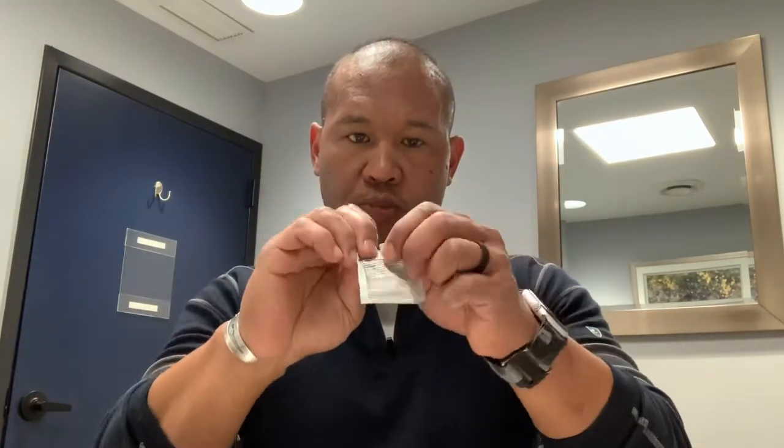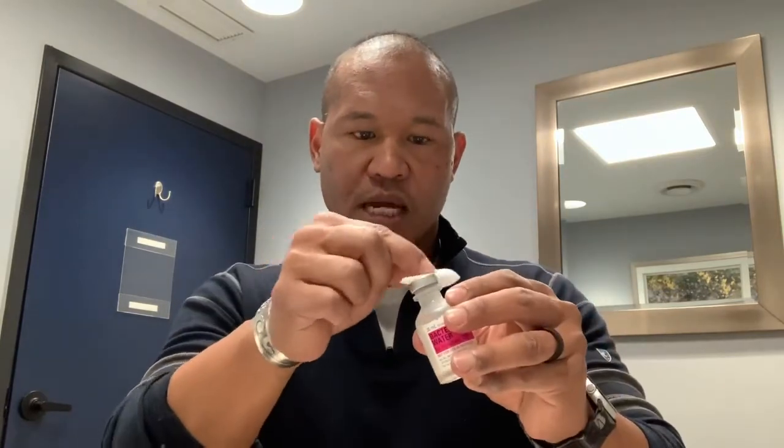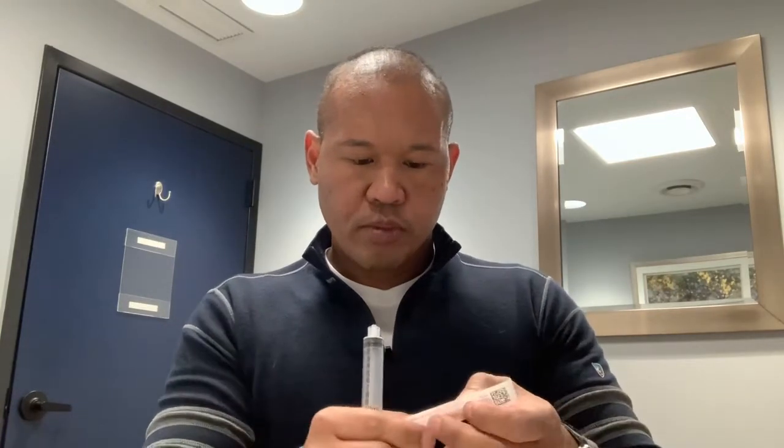Make sure you always wash your hands before dealing with any of your medications. Open up your alcohol pad, take your vial of bacteriostatic water, pop the top, and wipe it with the alcohol. Then also open the top of your peptide vial with the powder in it and wipe the top of that as well. These are now prepared.